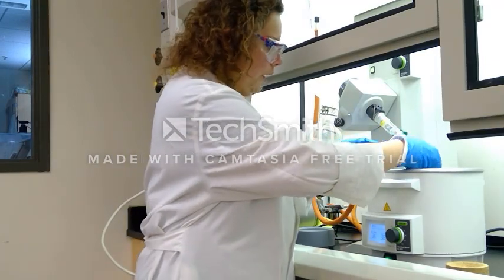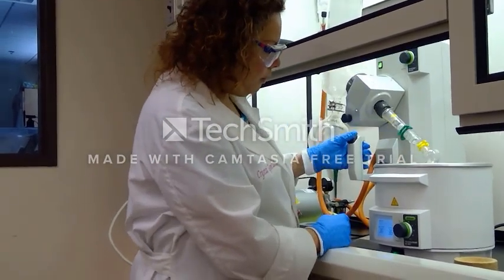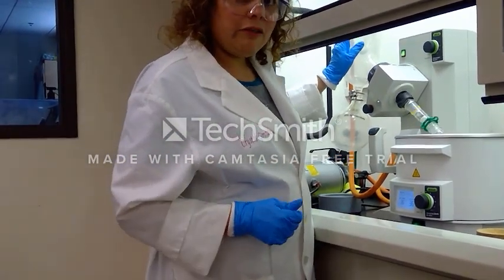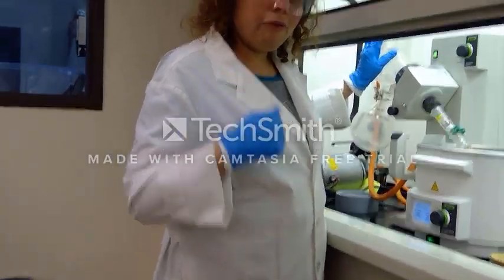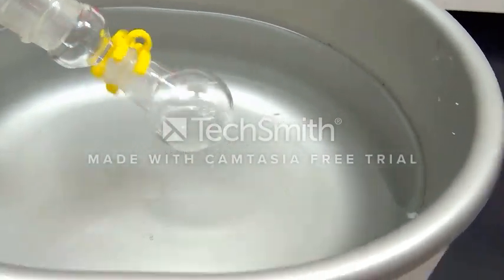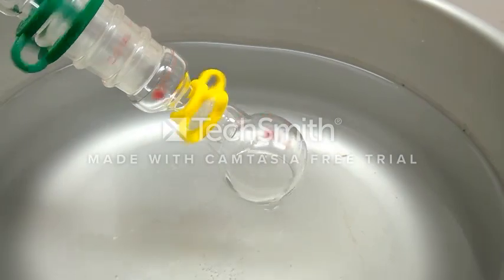We're going to evaporate our solvent — I'm adding the round bottom flask to the rotavap and starting rotation. Our water bath is currently at 36 degrees Celsius, which is a little warmer than normal, but we don't have dry ice in our cold finger today — just a mixture of ice and salt. We are already evaporating. I'm increasing the rate of spin to evaporate the solvent and retrieve a nice solid, after which we'll weigh it and take it to the infrared.